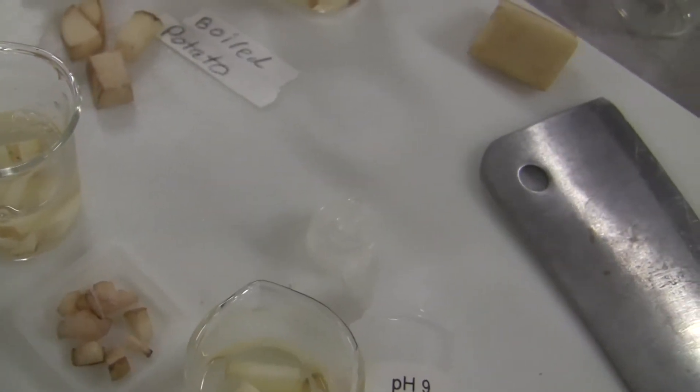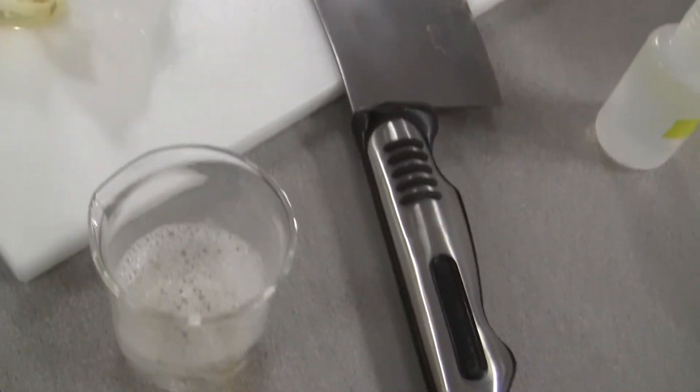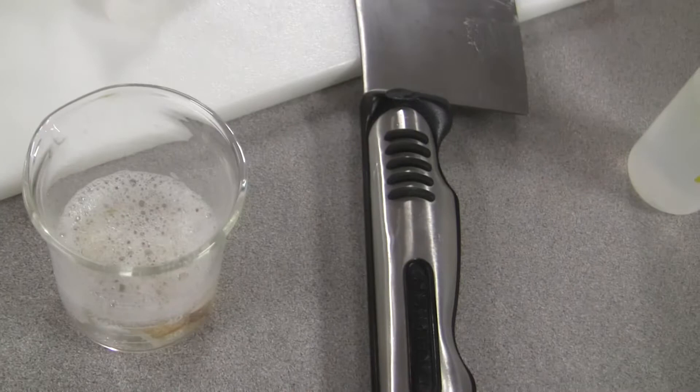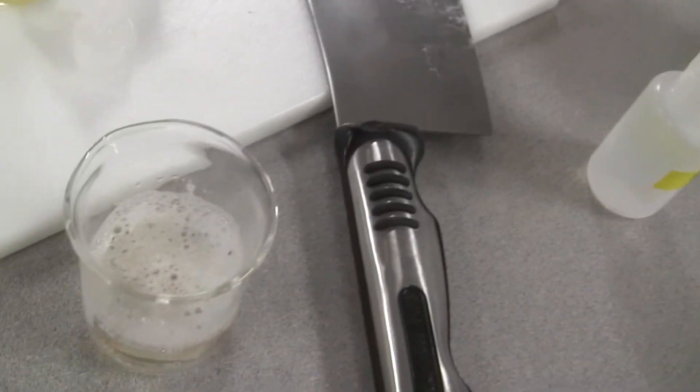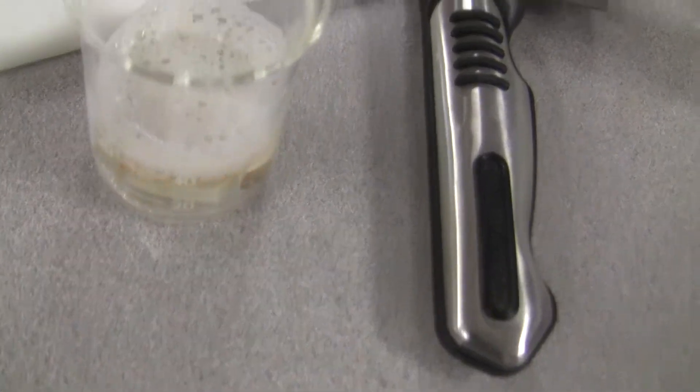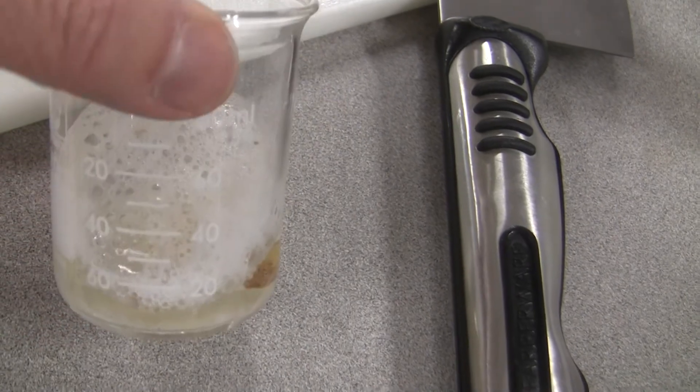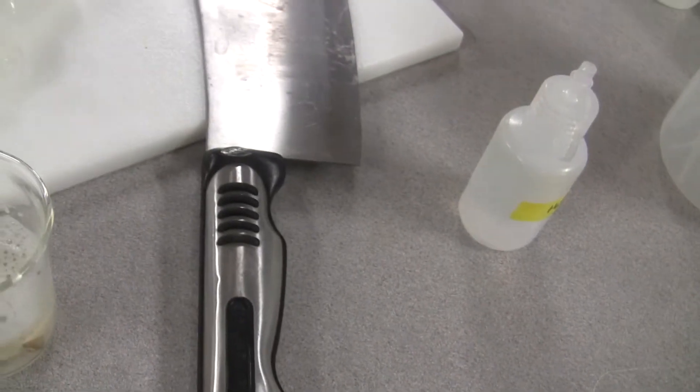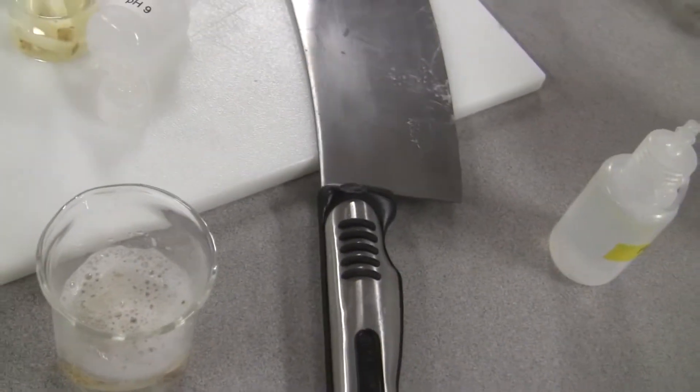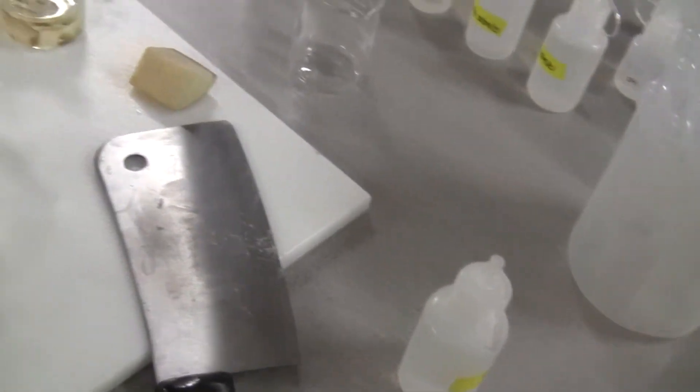And here, let's grab another beaker. Well, I've already done it for you guys. See, this is just hydrogen peroxide. You can see all of the foams. Here is hydrogen peroxide and potato. Potato on the bottom. You can see that. And hydrogen peroxide, if I can. Okay. Well, that's it. That's the type of bubble you get by putting hydrogen peroxide in there.